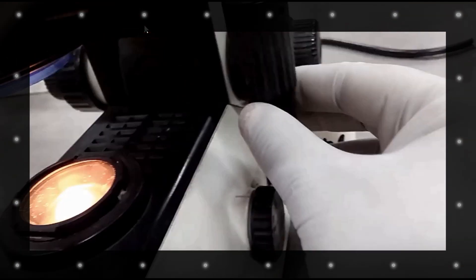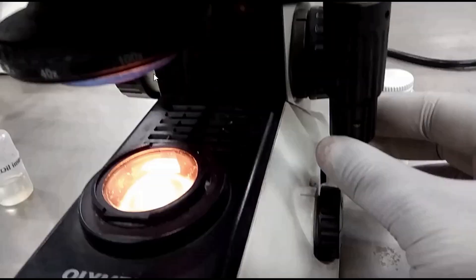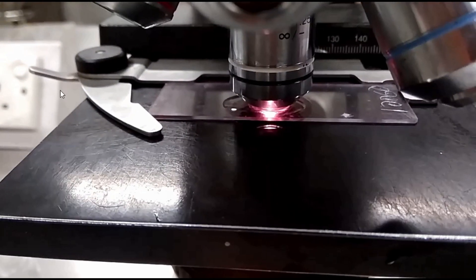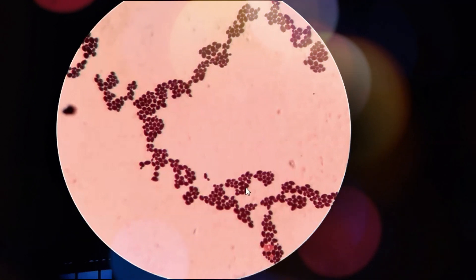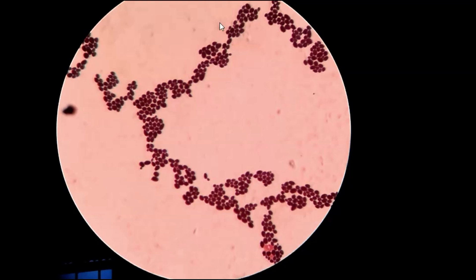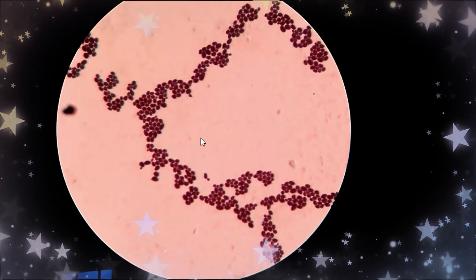Now we are ready to observe the gram-stained Candida slide on the microscope. First fix at 10x objective, and finally we are observing at the 100x objective, which is also called the oil immersion field.